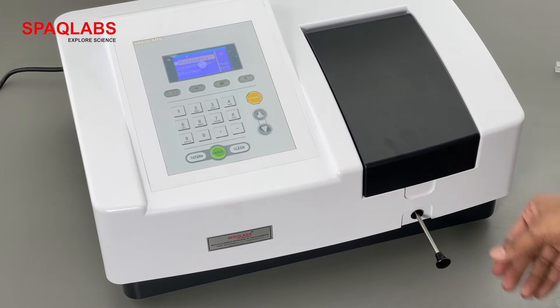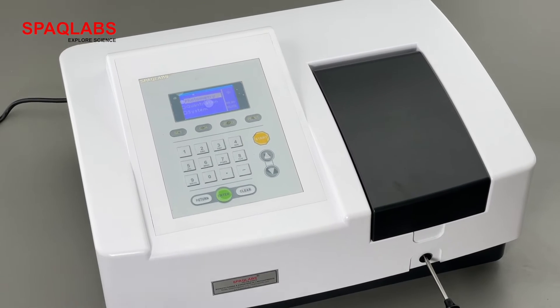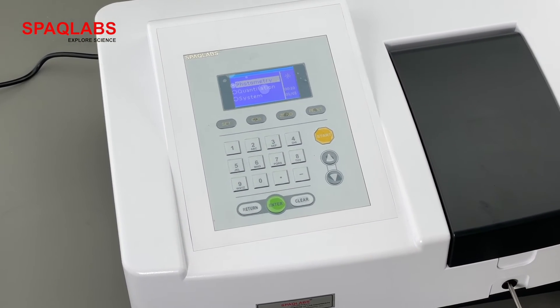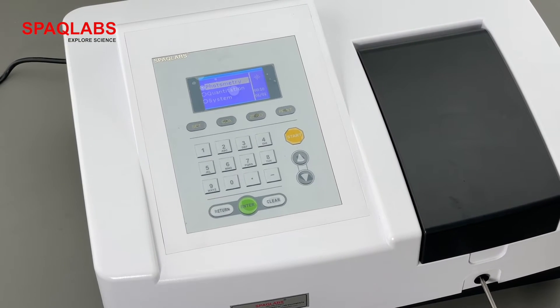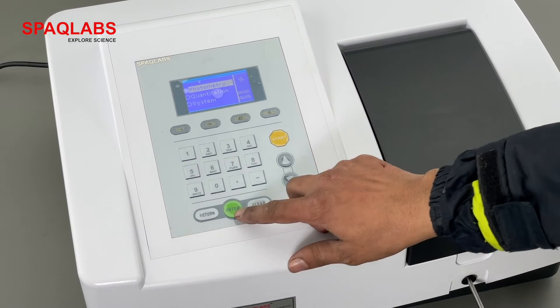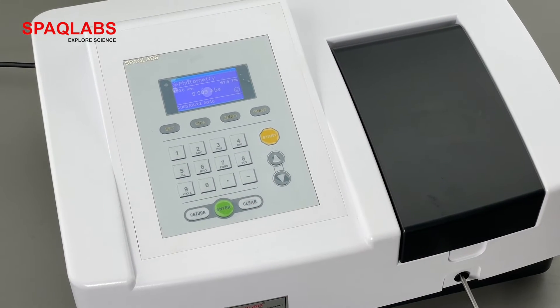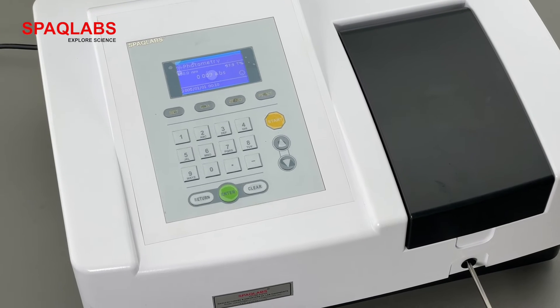Right now the first cuvette is selected. As you can see on the display, photometry mode is currently selected. Let's select this. Now as you can see on the display, some ABS value is showing.